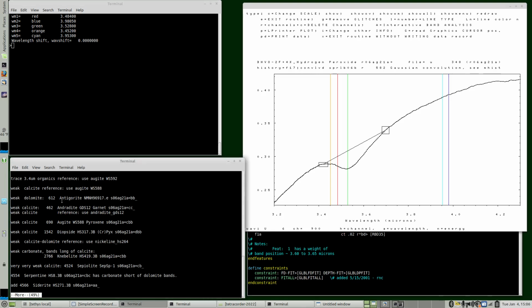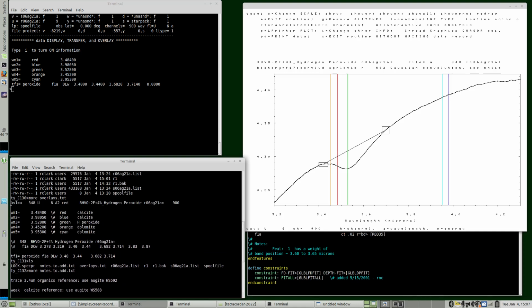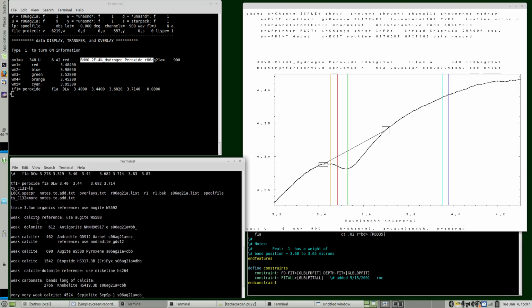And the first thing to look at is the full calcite. Let's look at the dolomite. It'll be a good example. First, I forgot to do one other thing. To keep the hydrogen peroxide spectrum on with any plot we do, we make it an overlay. So I'm doing this. Now we see that overlay 1 will be a red line, and this is the hydrogen peroxide spectrum. So now we go back down.